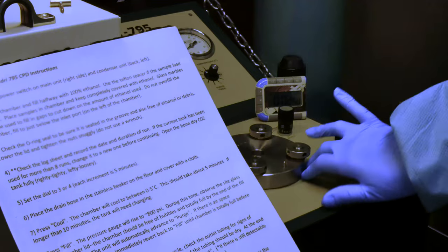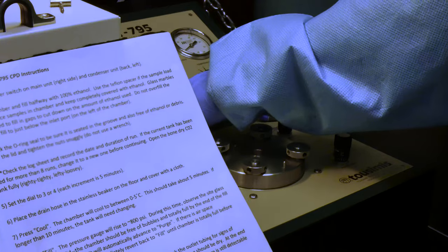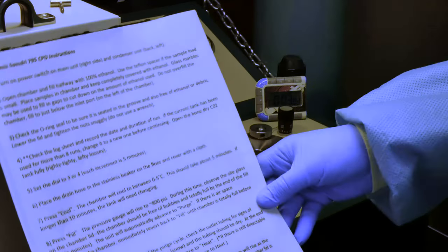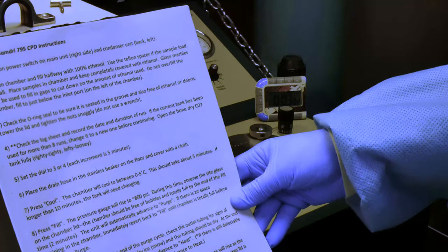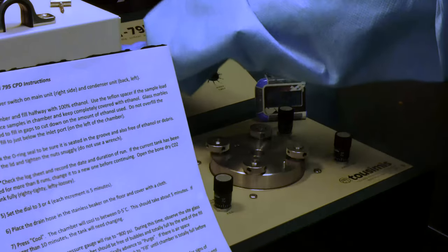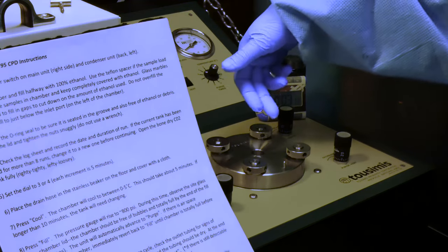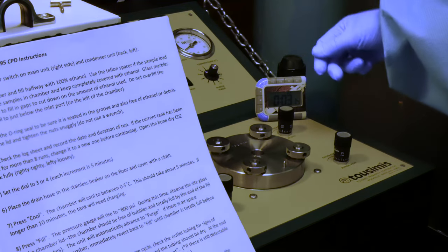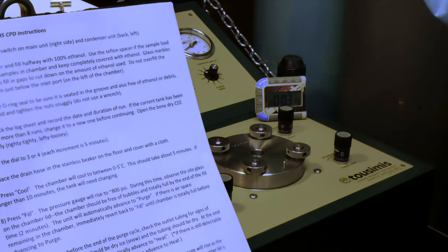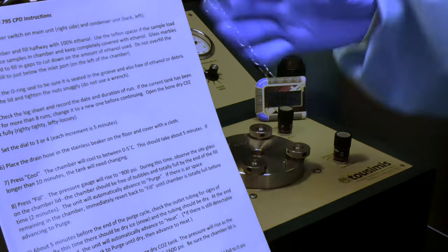And this is the time that you would be able to tell if you didn't have an appropriate seal. So we will advance forward. We have to manually advance that. This also is associated with a noise. During this time, the pressure will start to increase. You will see the injection of the CO2 liquid. There will be a bubble that gets smaller and smaller, and we want to see that bubble entirely disappear.